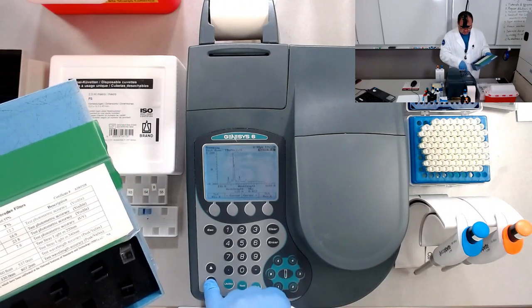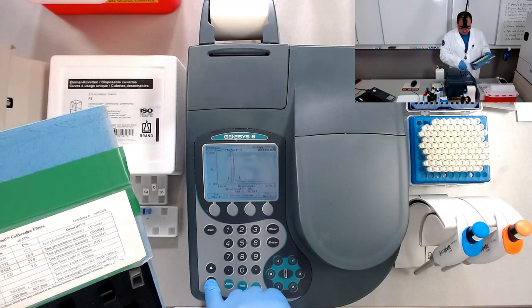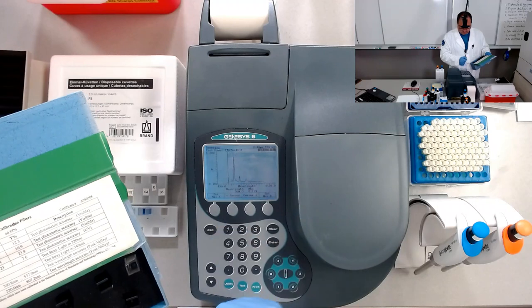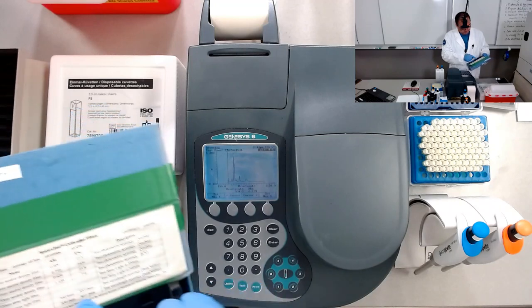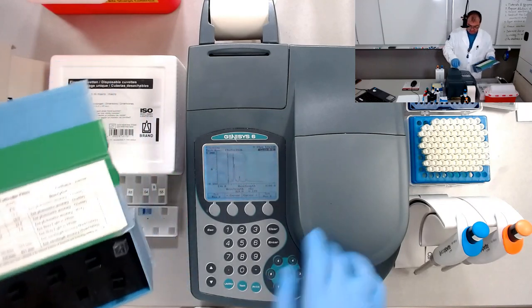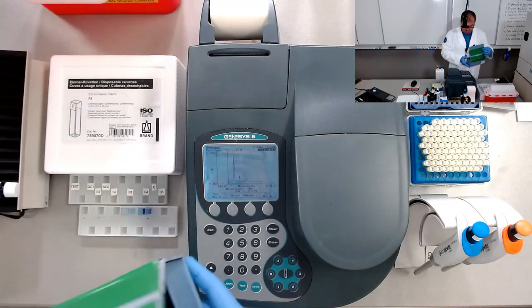So going for the next peak in here that shows up at 360.8. Okay, not that one. 360, I think 360. Look at this one. So 360.8. Again, with a finer step, I would have been able to provide you a more accurate value, but still you see that the peak kind of matches whatever the manufacturer of the filter provided us. So this instrument measures and provides the wavelength very accurately. So this is the absorption spectrum for holmium.